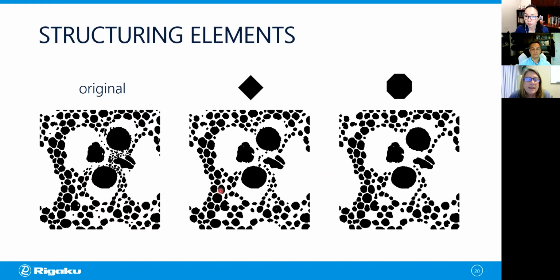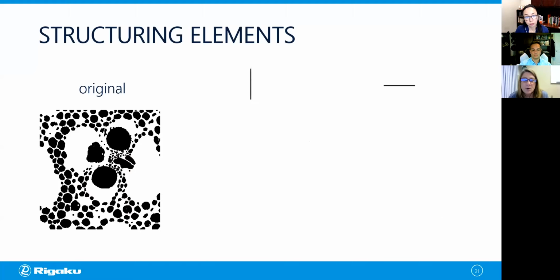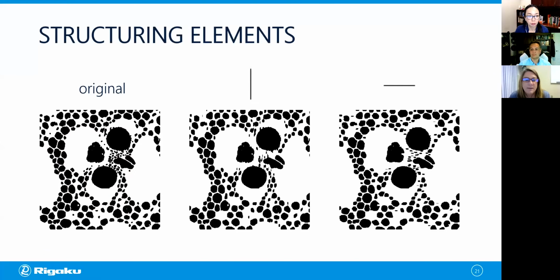And again, here we get some blocky character from the diamond shaped, and on the octagon, they look like they have smooth edges, more consistent with the original void. Now what happens if we use some of these lines? So we're going to consider the vertical and horizontal lines. And here we're going to see with this particular binary image with circular shaped voids, there's a dramatic effect. And so, for example, with the vertical line, now we see that our void shapes are biased towards the structuring element and they look like vertical lines themselves. And similarly, using the horizontal line, we have horizontal voids rather than rounded ones.